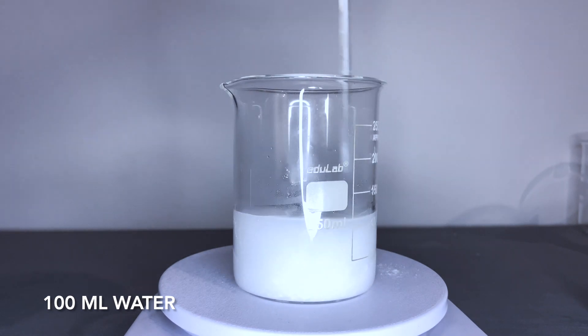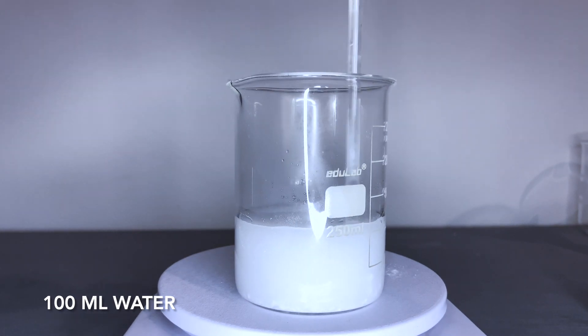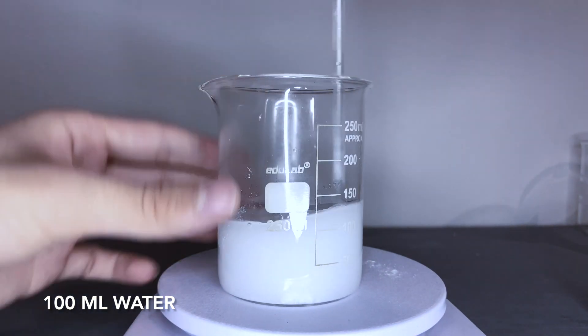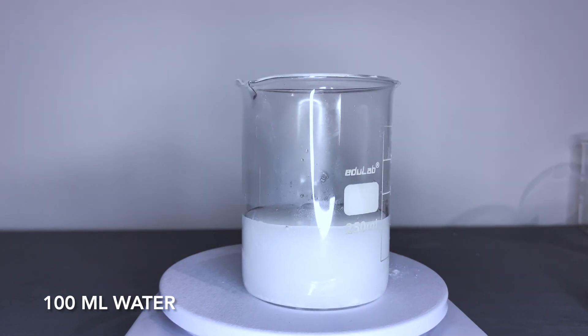Actually, in this part, you must wait until you get a clear sodium carbonate solution. You can see my clear sodium carbonate solution while I am mixing copper sulfate solution and sodium carbonate solution.